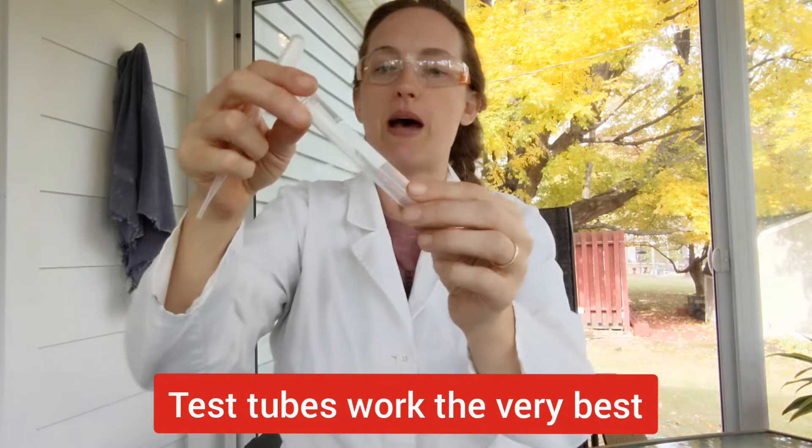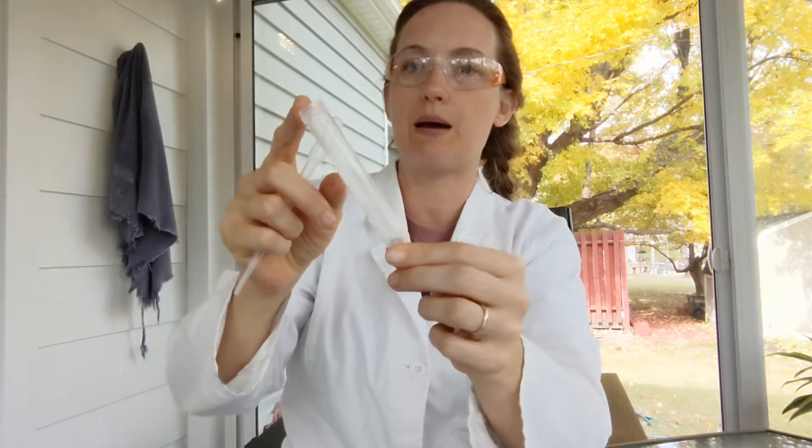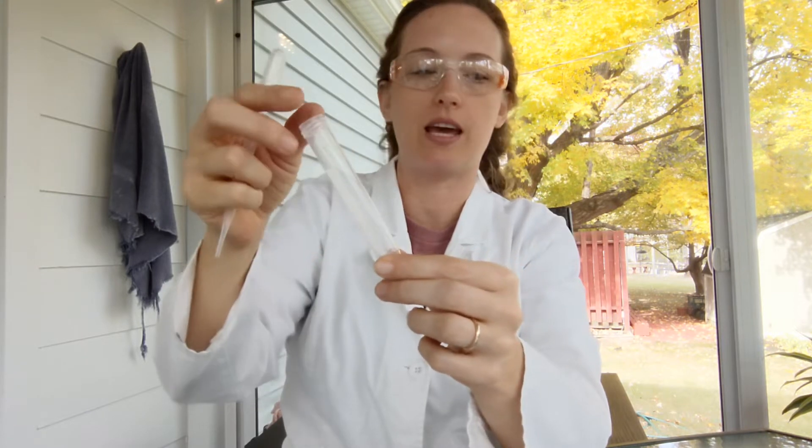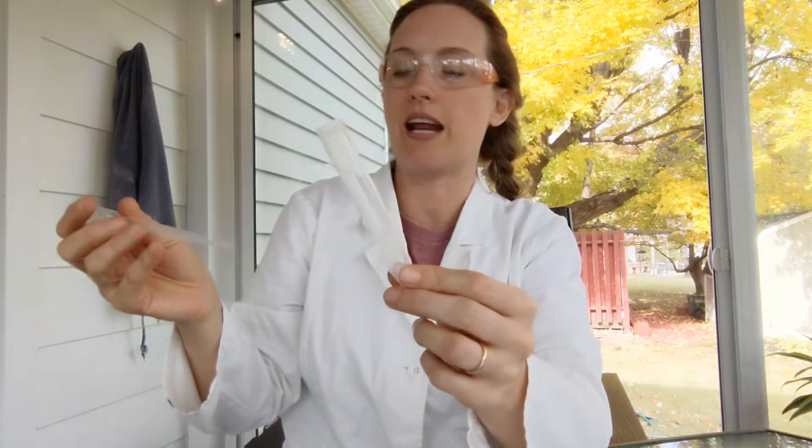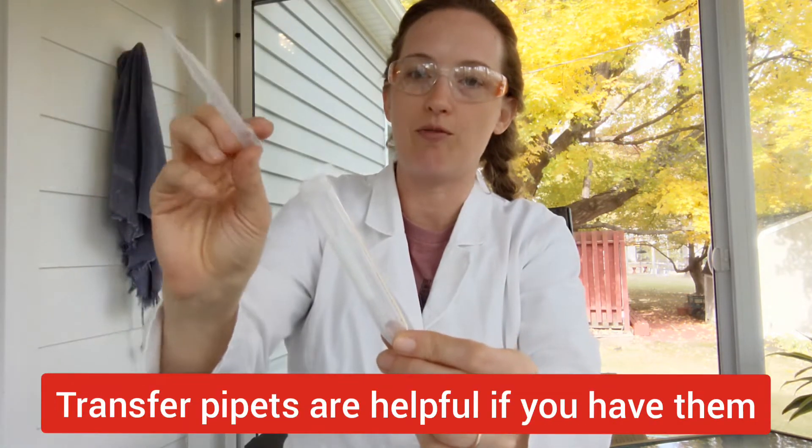If you're doing this in the classroom, then it's best to do it in some kind of a tube, like a test tube. I like to use these screw top tubes and let my students take their DNA with them when they go. And also having a transfer pipette can be helpful if you're doing this version in the classroom. But if you're doing it at home, you probably don't have test tubes and pipettes and that is totally fine.